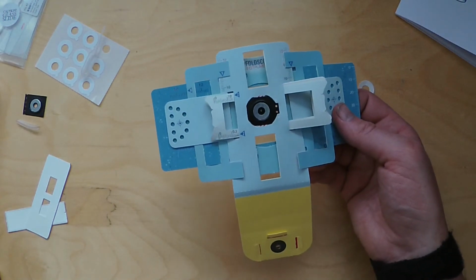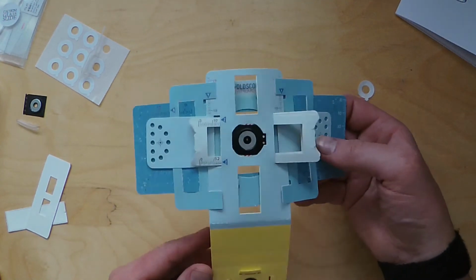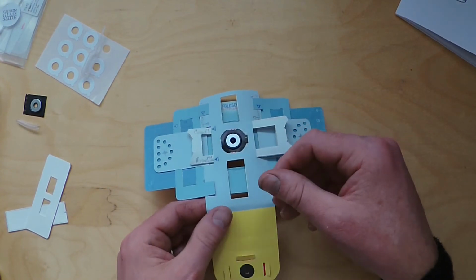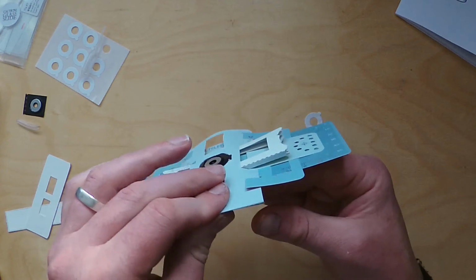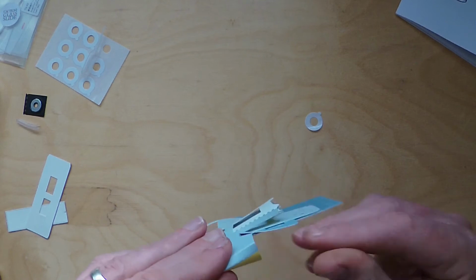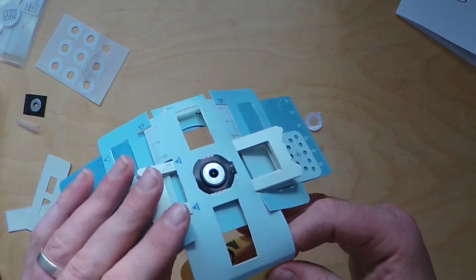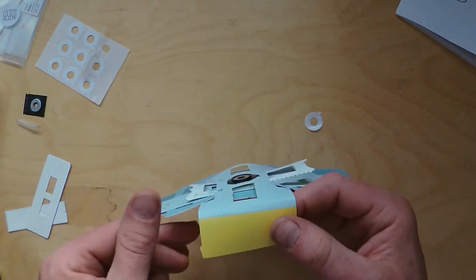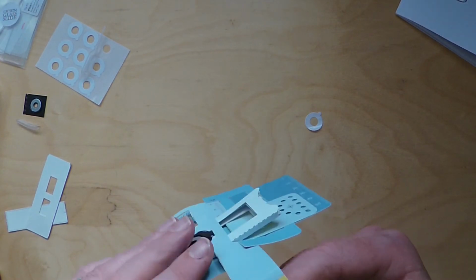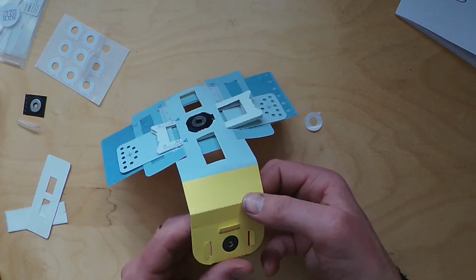The next stage is to fold up the bottom of the lens stage. So again, the blue at the top and yellow at the bottom, this side up. You want to fold that perforation down, the next perforation down, fold that down, fold this down. So when I say down, I mean down that way, because this is going to fold down like so. But the last one, you want to fold that up.